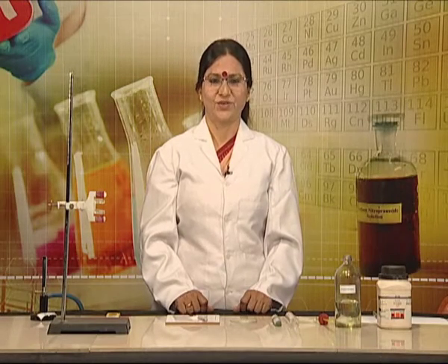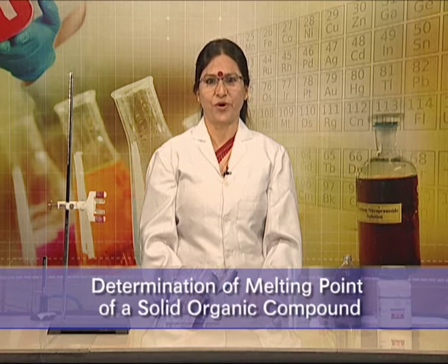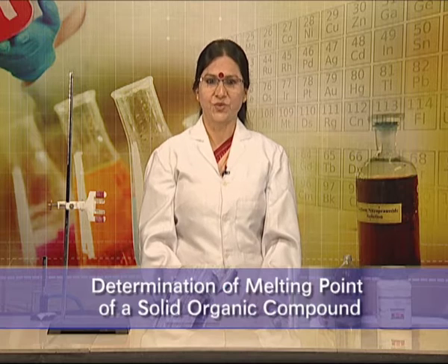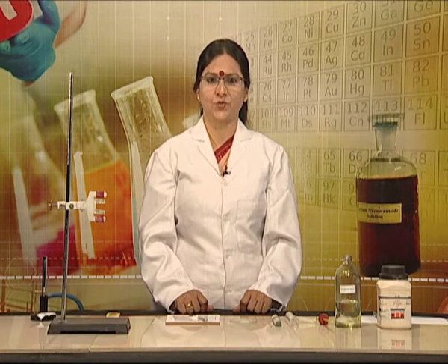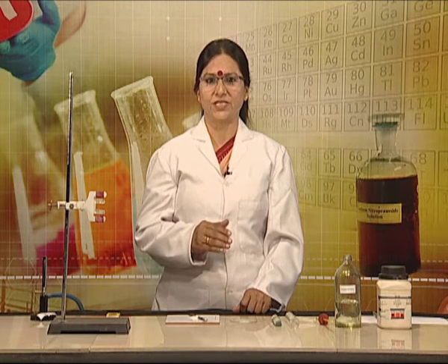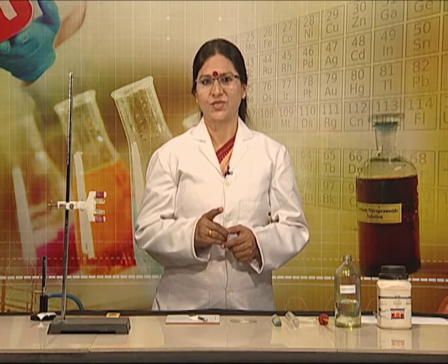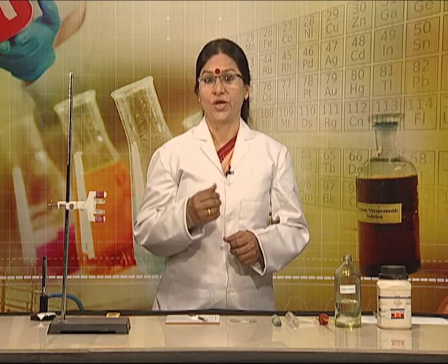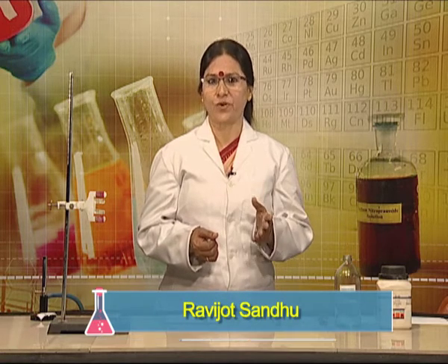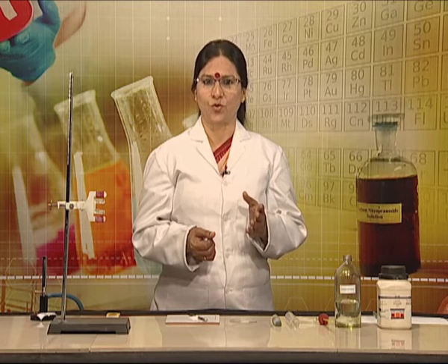Hello Learners! Today we are going to learn determination of melting point of a solid organic compound. The temperature at which a given solid state of a substance begins to change into liquid state at one atmospheric pressure is called melting point. You can also define this as the temperature at which the solid and liquid forms of a substance can exist in equilibrium.